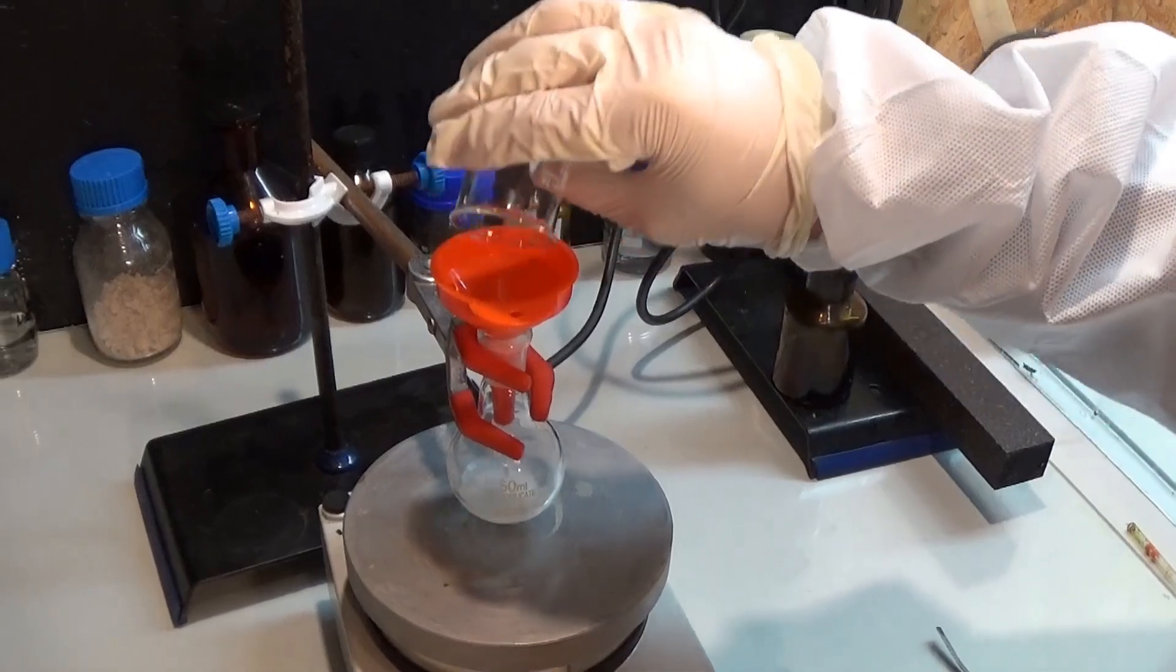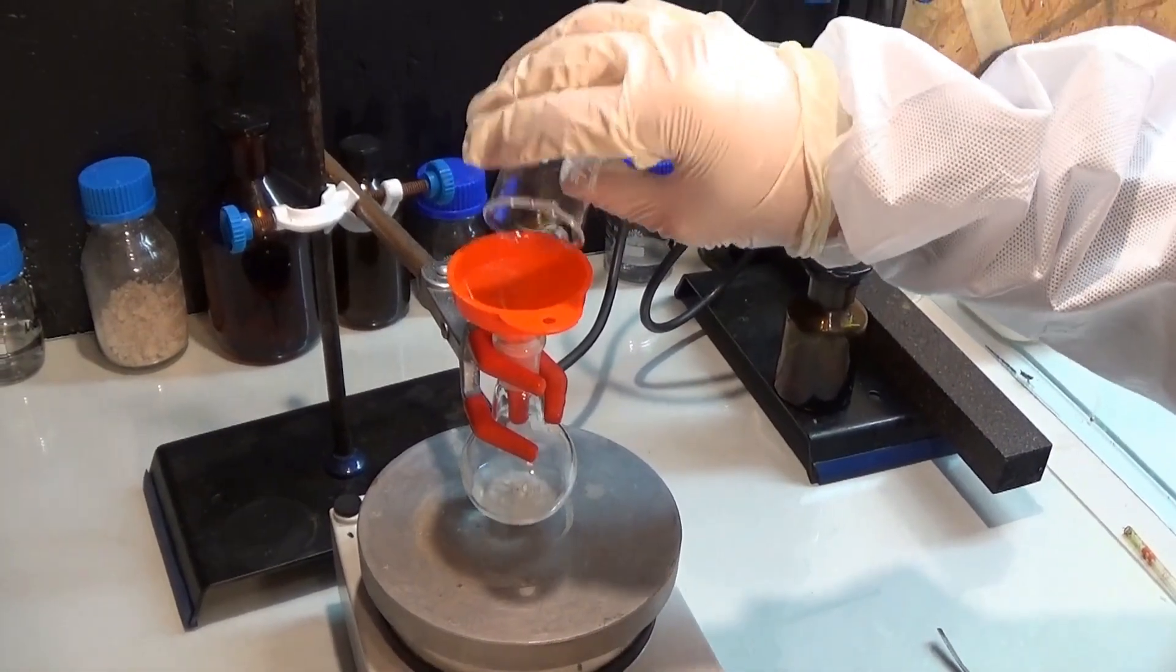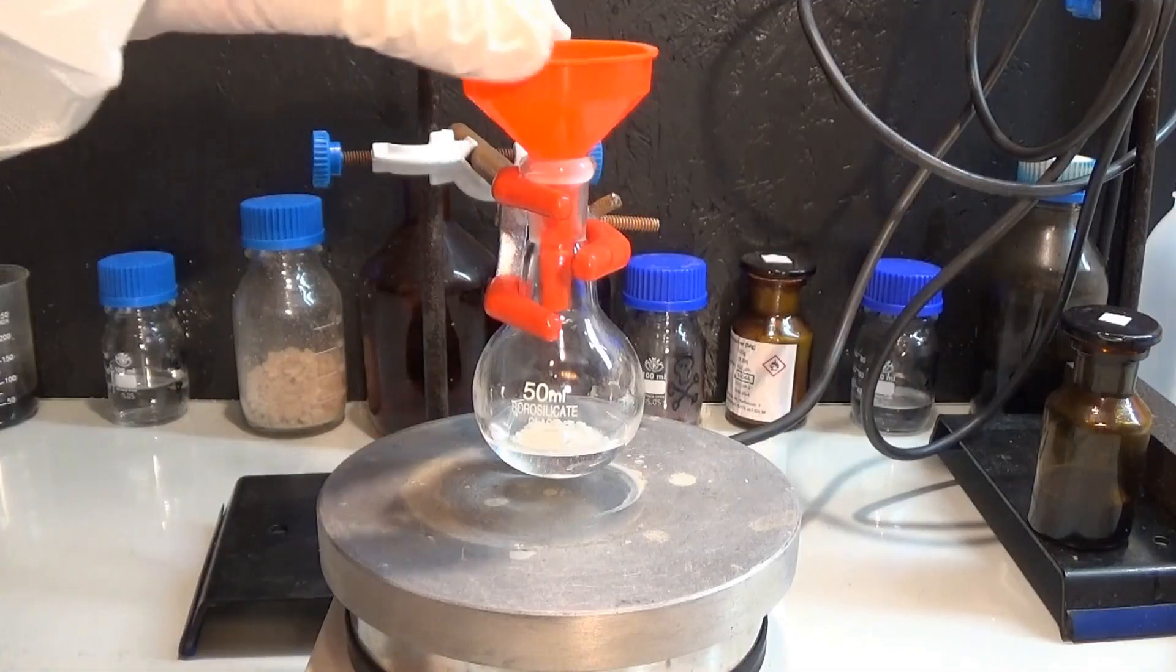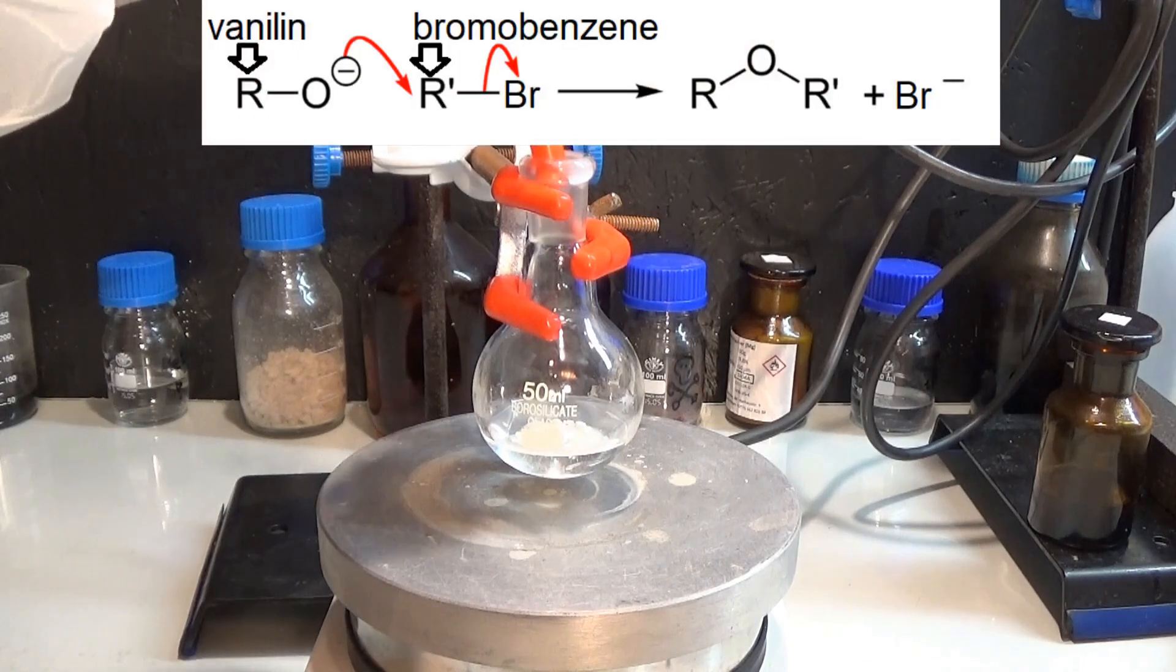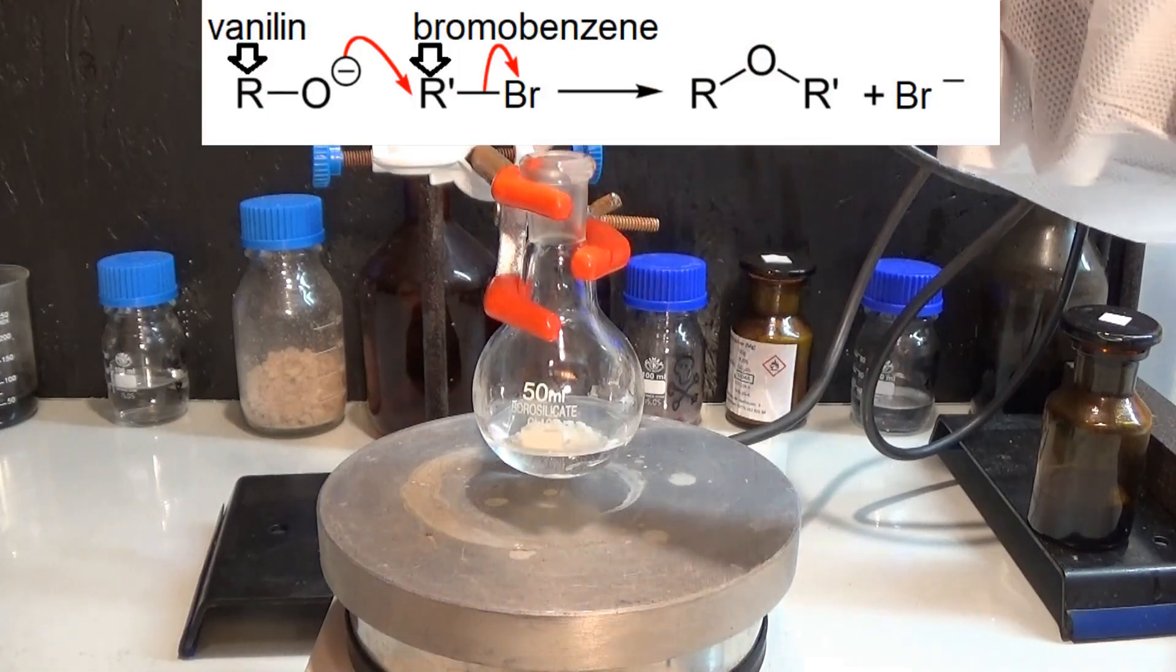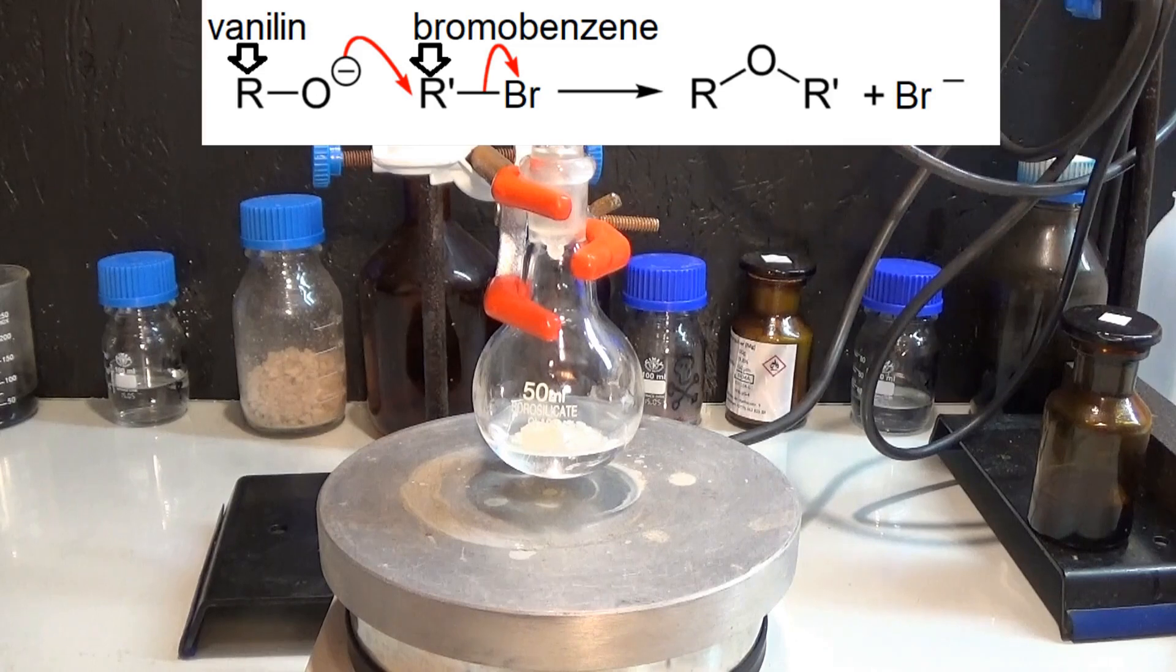The second reactant to follow is the sodium hydroxide dissolved in acetone. To get this reaction to work properly use acetonitrile as solvent.